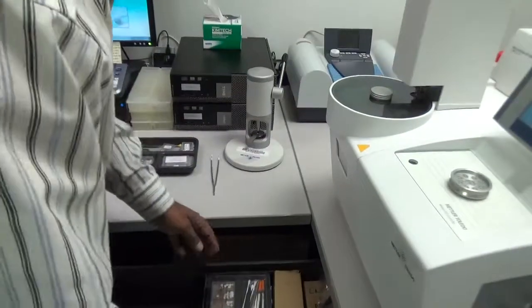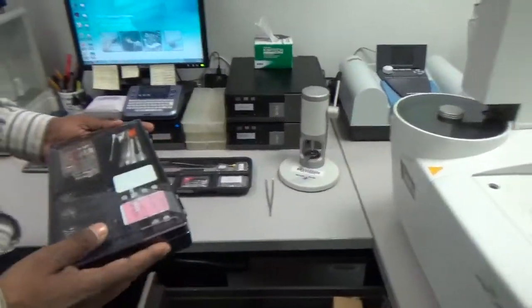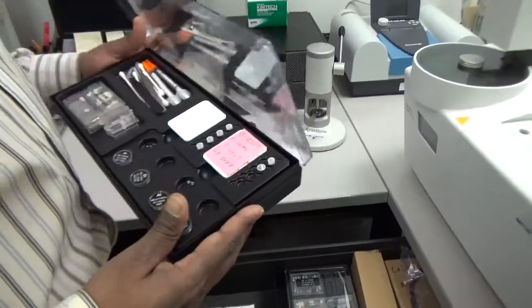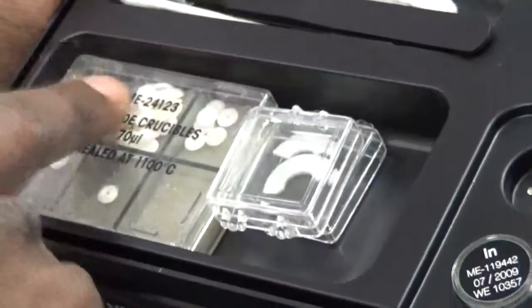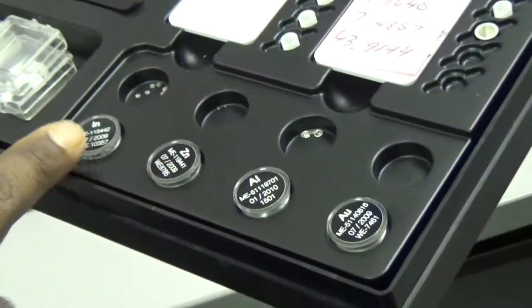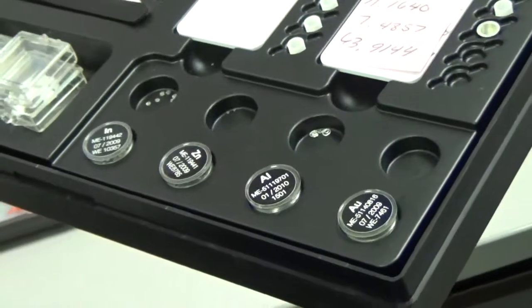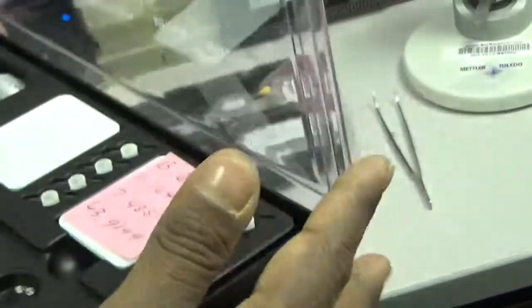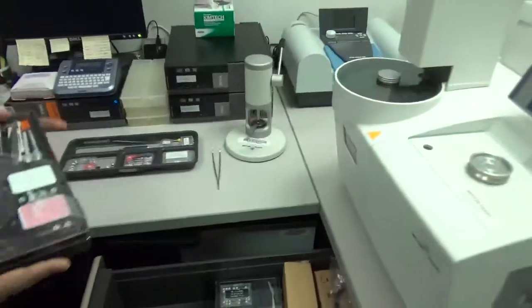These are the calibration standards. We always calibrate the machine before we do a run. Calibration is done with indium, zinc, aluminum, and gold — these four standards are used for calibration. We do the calibration regularly to make sure the machine is running properly before we start putting our samples.